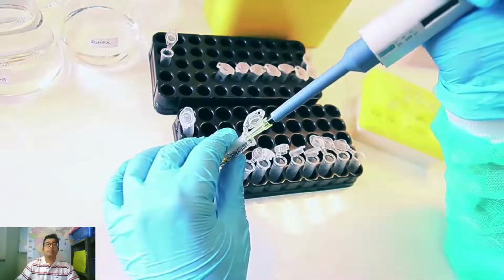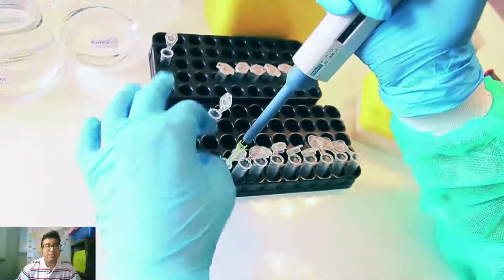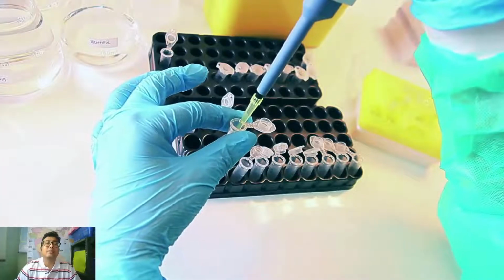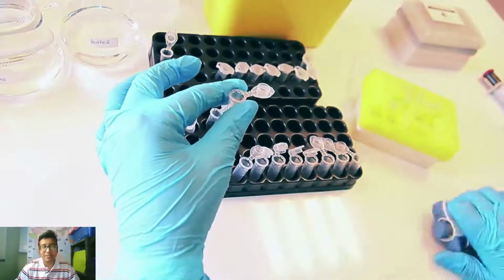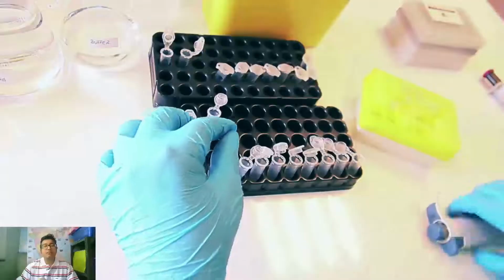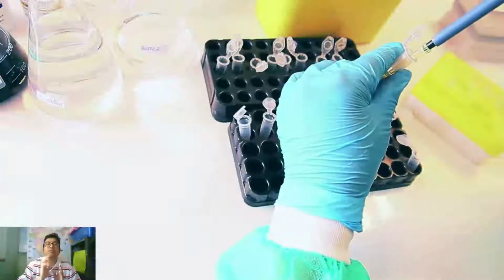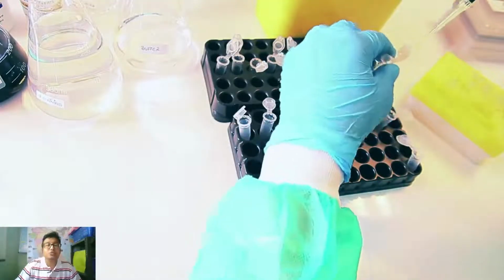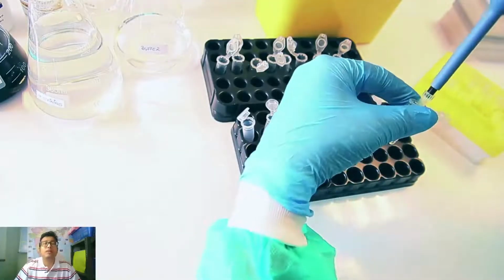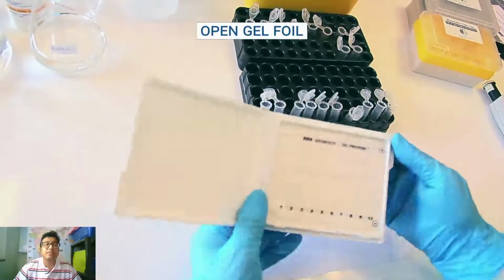The used tips are to be properly disposed, because these are serum from real human patients, and they can contain infective organisms, right. So the principle is to mix some amount of serum and some amount of dye, okay. The amount of dye will actually guide us as to where we are applying the serum sample, because if you are doing it blindly, you will not have any idea, because serum is colorless, okay.